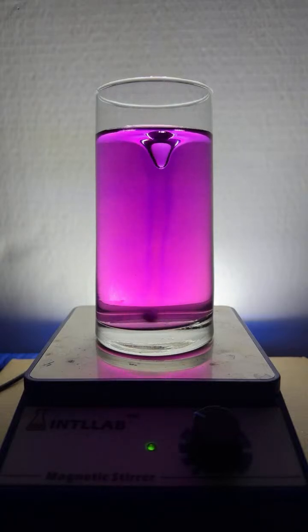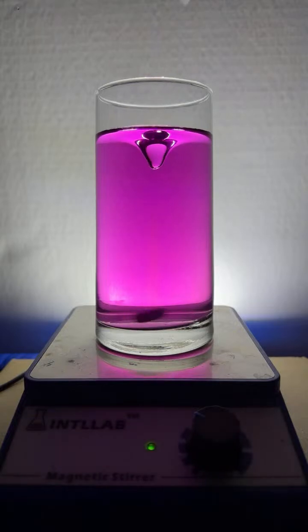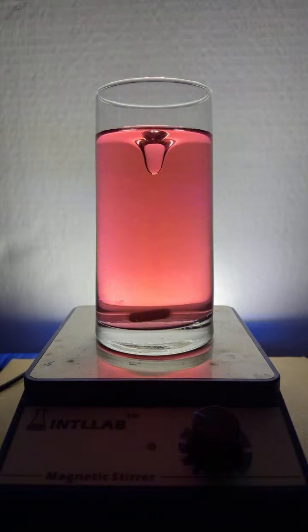Ooh, look at that. There's your magenta. Tracy was calling it a magenta. We'll add another drop to get it to the more red color. Actually, 2 drops. Yeah, lots of neat color changes there. It's really looking nice. All right, I'll add 2 drops here while I set up the next flask.